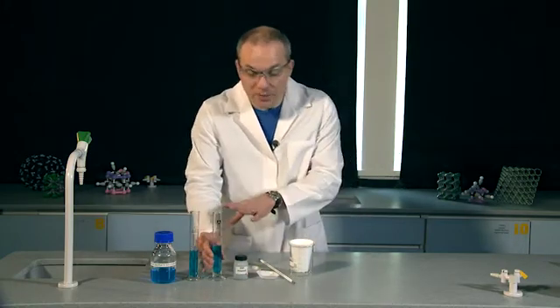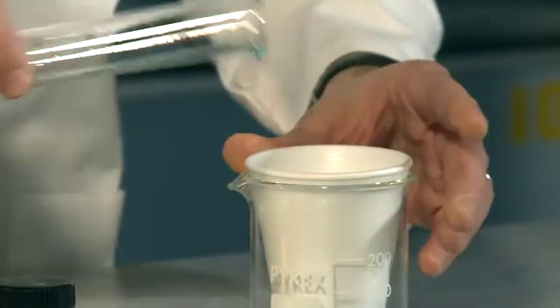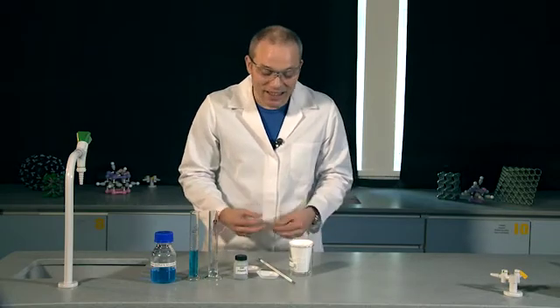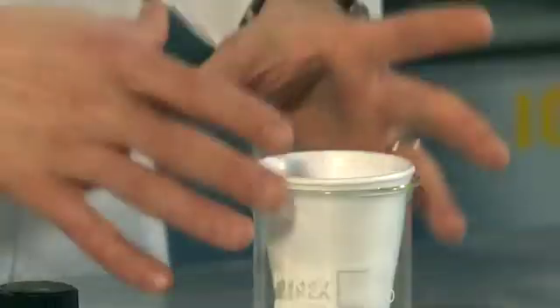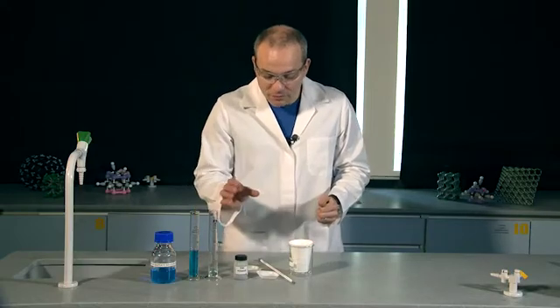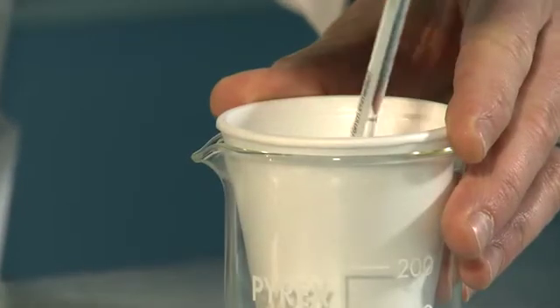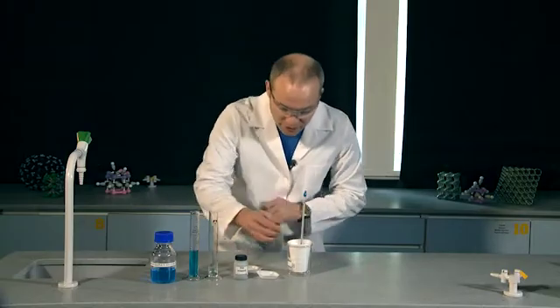I'm going to pour my pre-measured 30 centimetres cubed into my polystyrene cup. I'm using a polystyrene cup because the reaction releases heat energy and I want to trap that heat in the solution so I can measure the temperature rise accurately — polystyrene is quite a good insulator. I need to measure the initial temperature of the solution, and it's always good to stir it first to make sure there are no pockets of heat before taking the temperature.